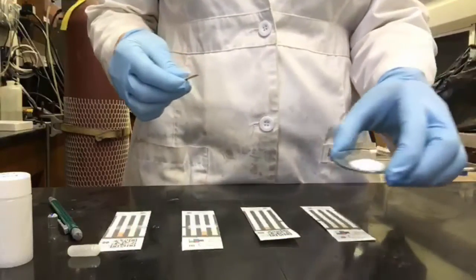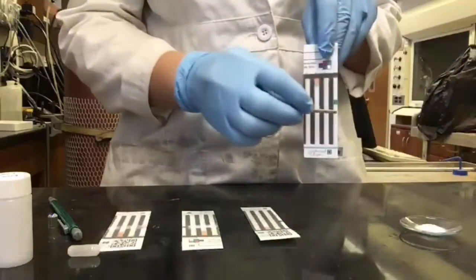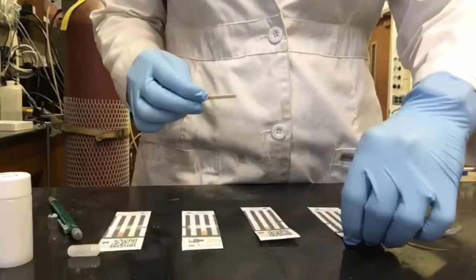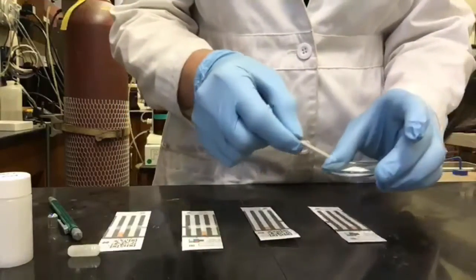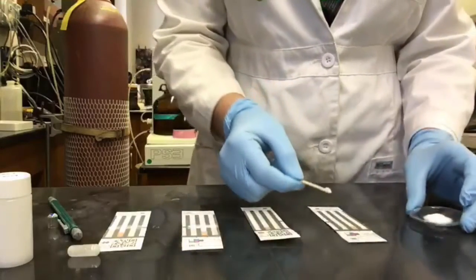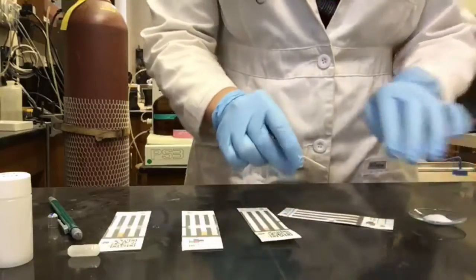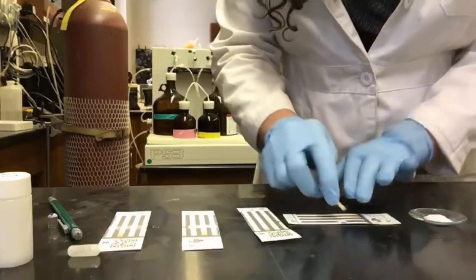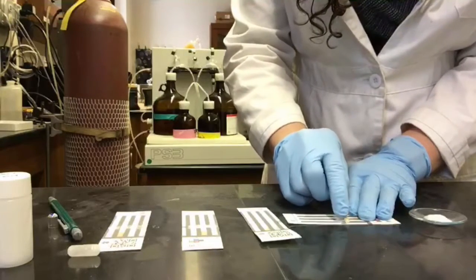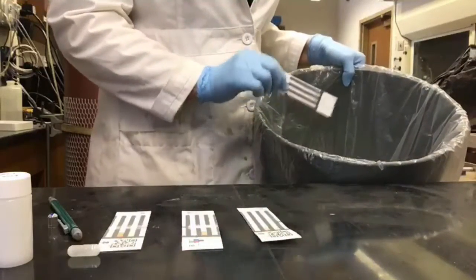The next step is to swipe the materials to be tested across the swipe lane. This lane is indicated with either a green block or a black arrow, about 1/3 of the way from the top of the lanes. Place your powder across the pad lanes using a wooden spatula. Then use the spatula and use some force to rub the powder well into each lane. Push hard to do this. Dispose of any excess powder in the wastebasket.